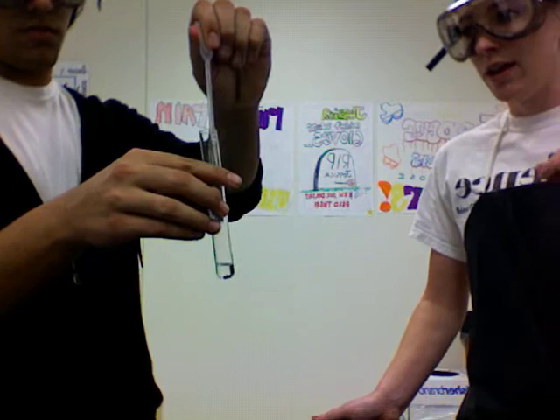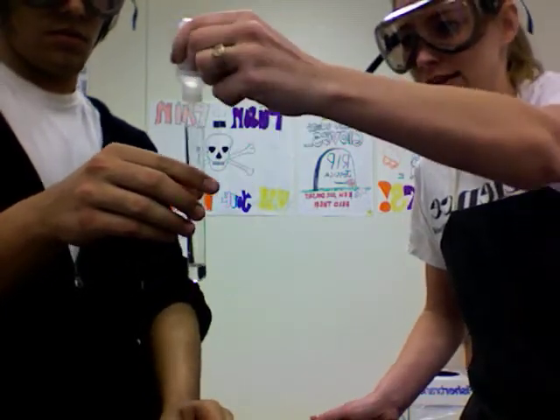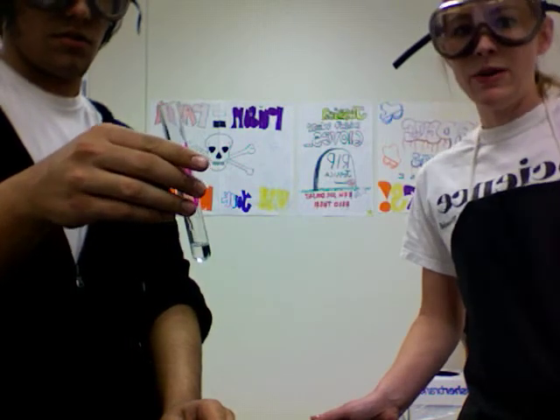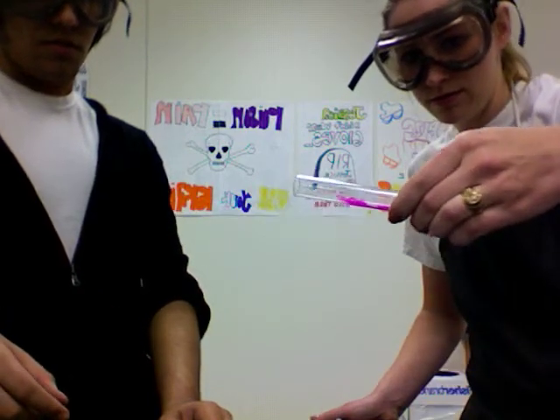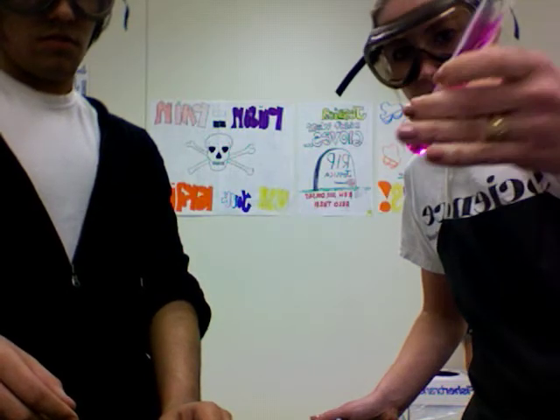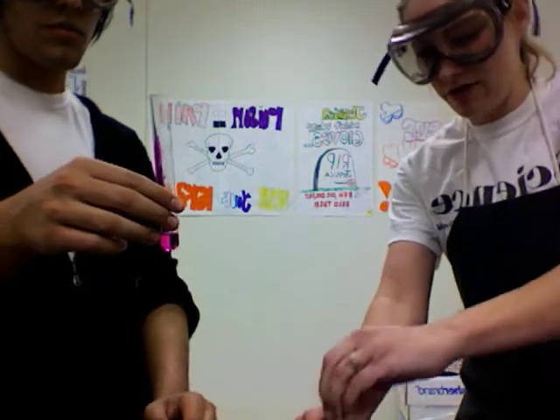Squirt the whole thing in there. And we're going to add to it one drop of our phenolphthalein indicator. This is an acid-base indicator that changes pink in the presence of a base. So we have a pink fluid because it is basic — sodium hydroxide is basic.